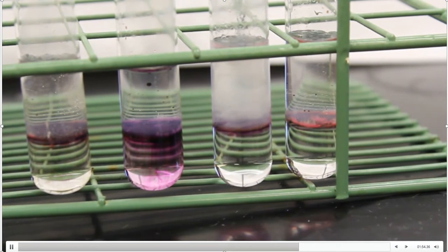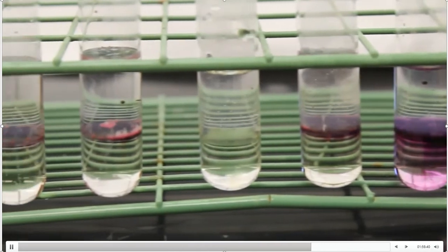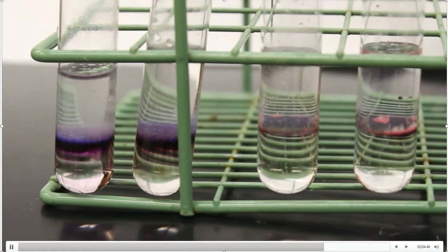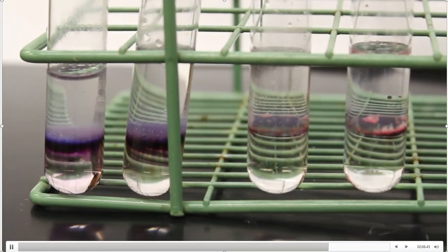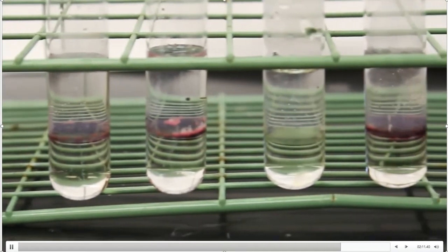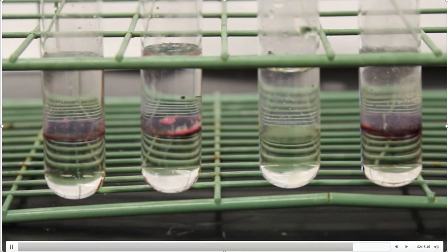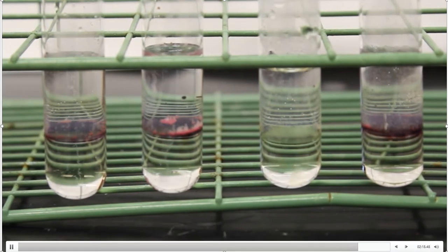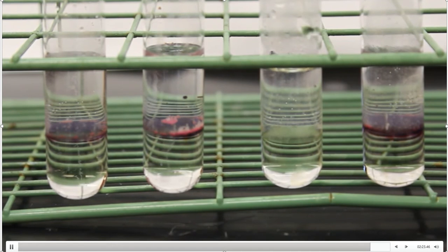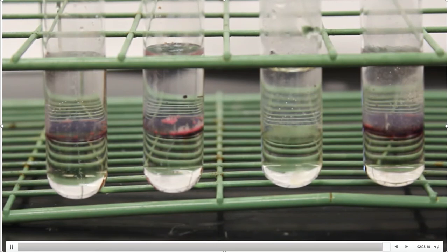So there is a close-up view of all the test tubes we have tested in this qualitative test. We know which ones are carbohydrates — those should give us a positive test. The two in the center are our unknowns. Are those unknowns carbohydrates or not? That is the purpose of the Molisch test, and now you know what that observation should be with the Molisch qualitative test.